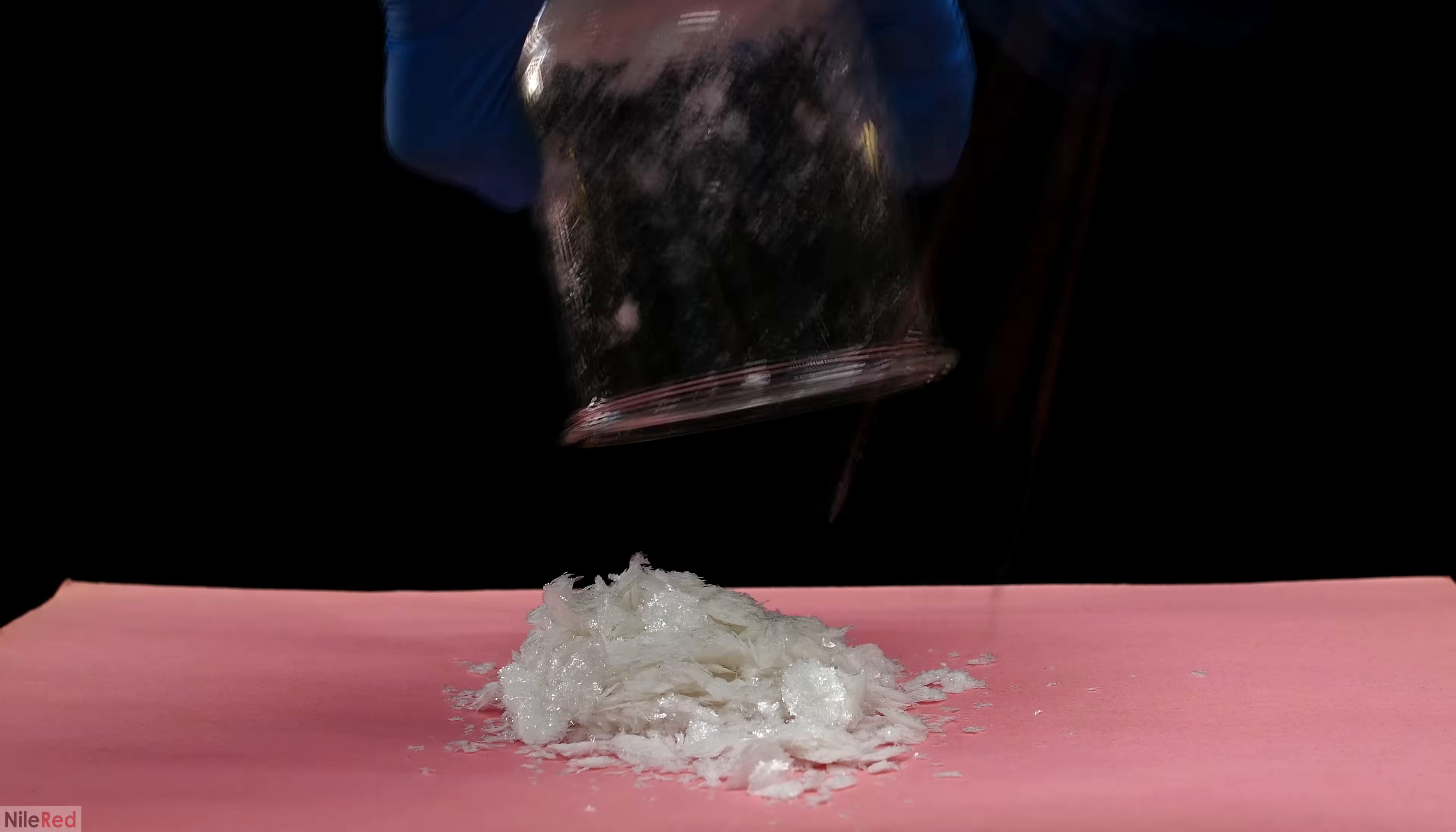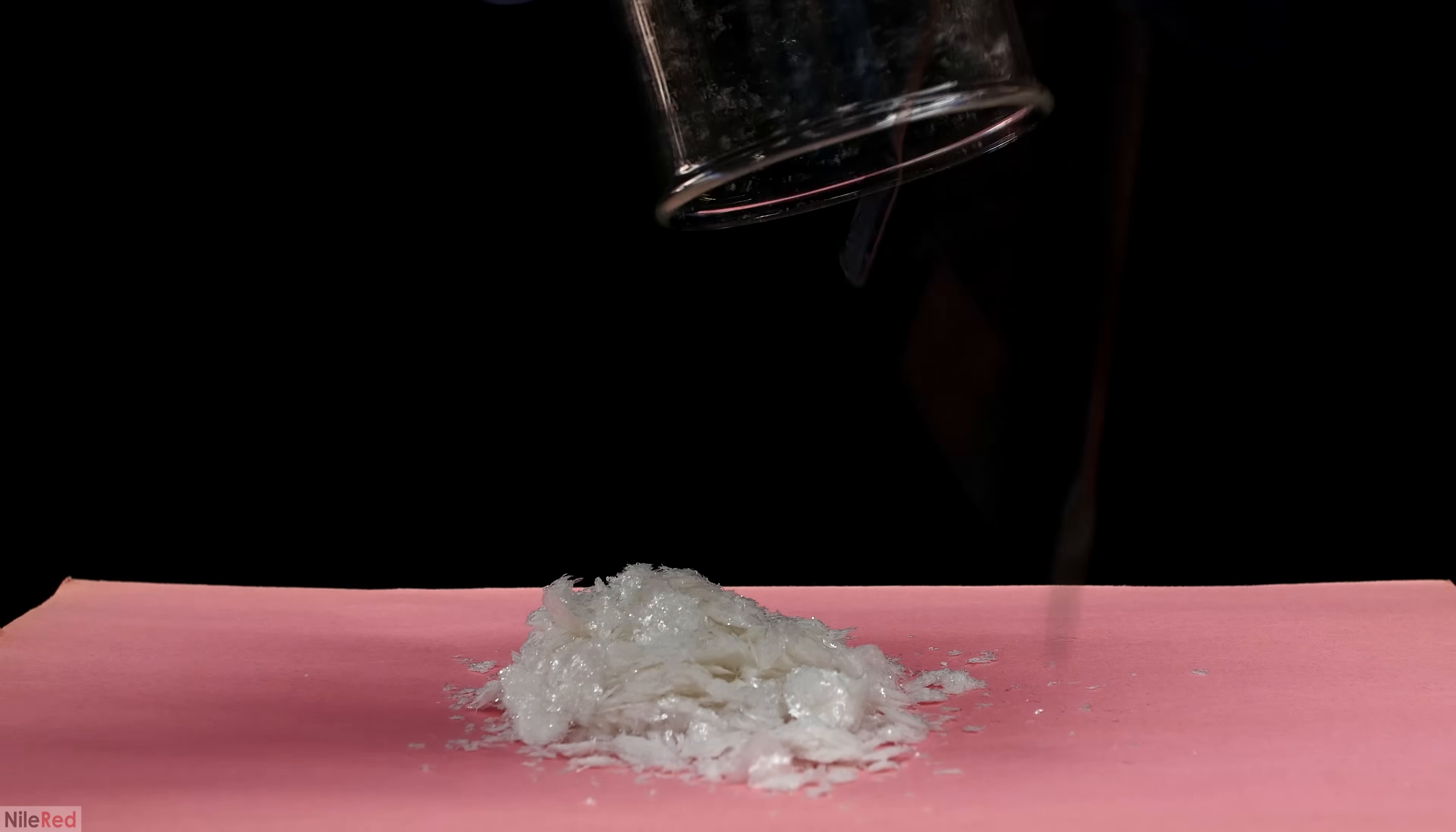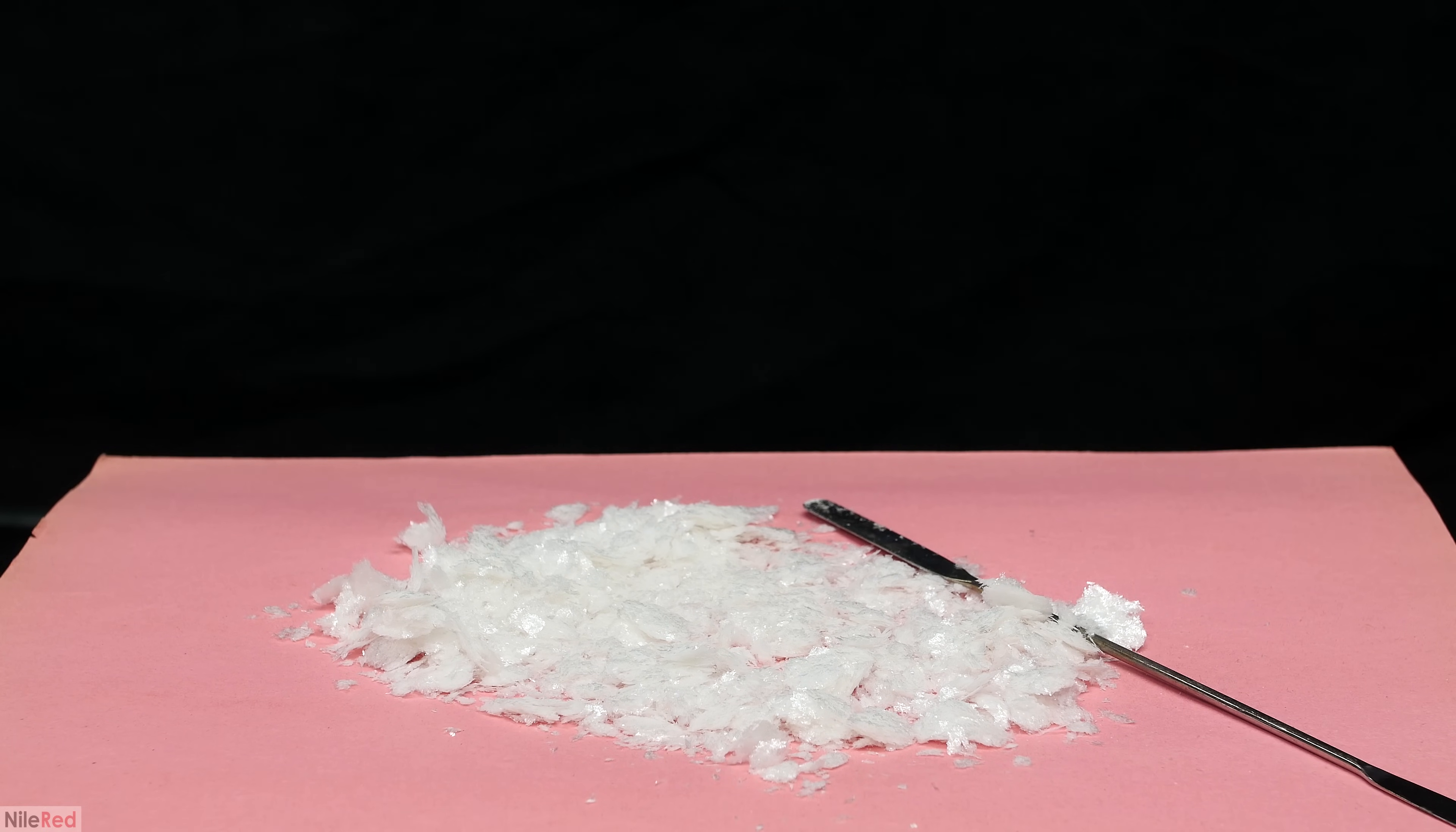The crystals were then dumped out onto a piece of construction paper with some paper towel underneath. I then spread the crystals out and I left them overnight to dry.